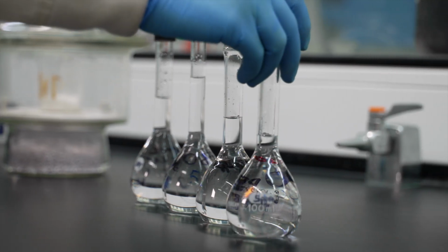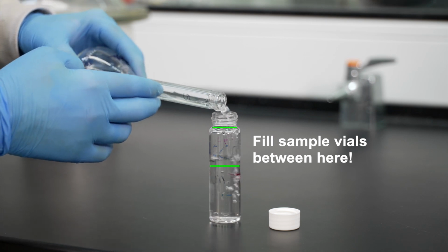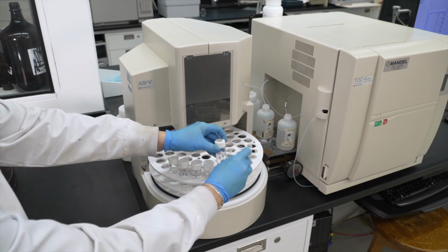Once your standard solutions have been made, you need to transfer them to instrument-specific sample vials. Ensure that an appropriate amount of volume has been added to each vial, or the instrument won't be able to analyze your sample.